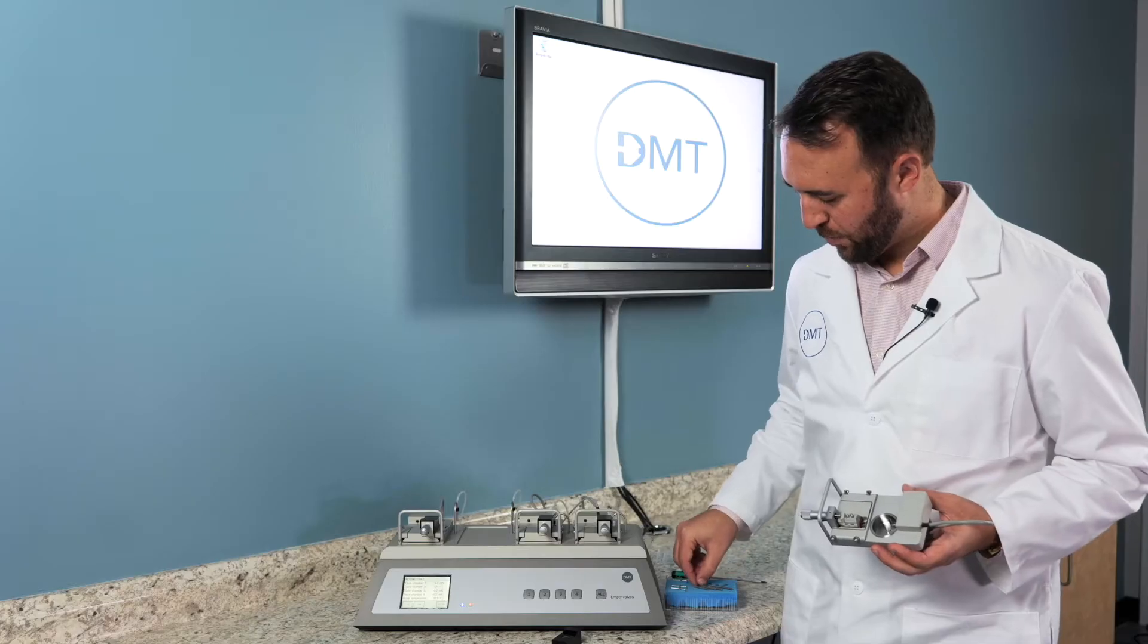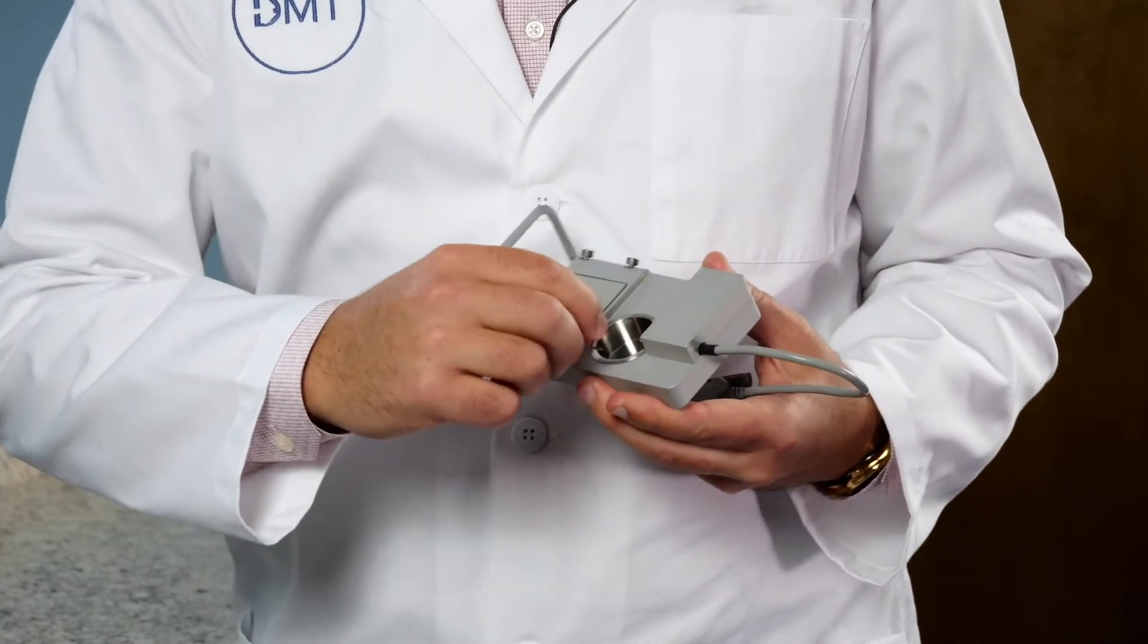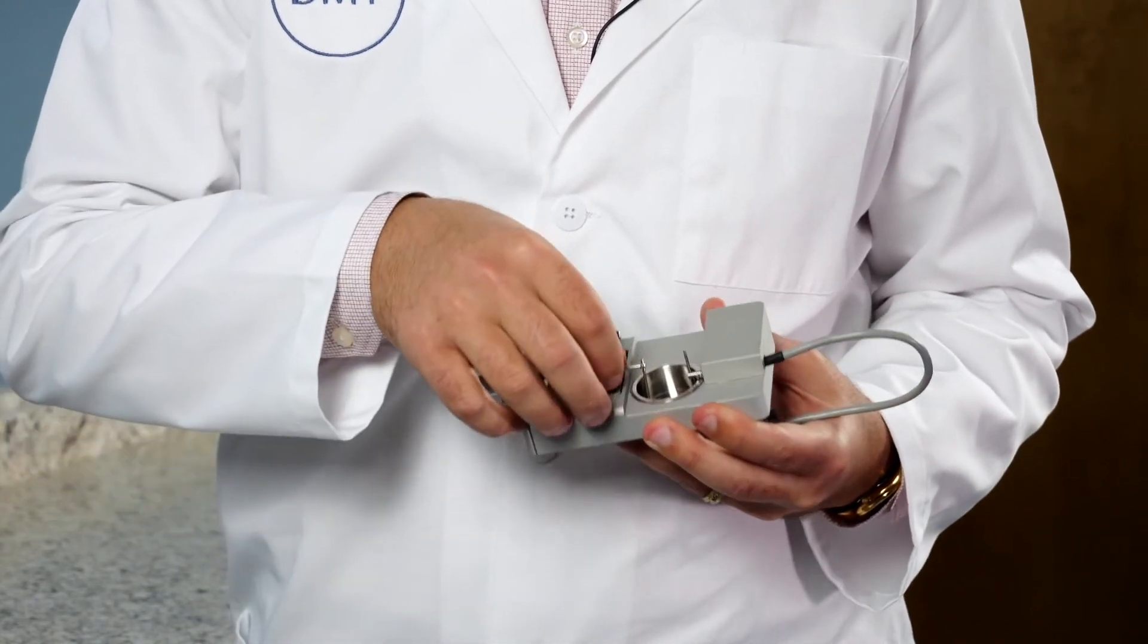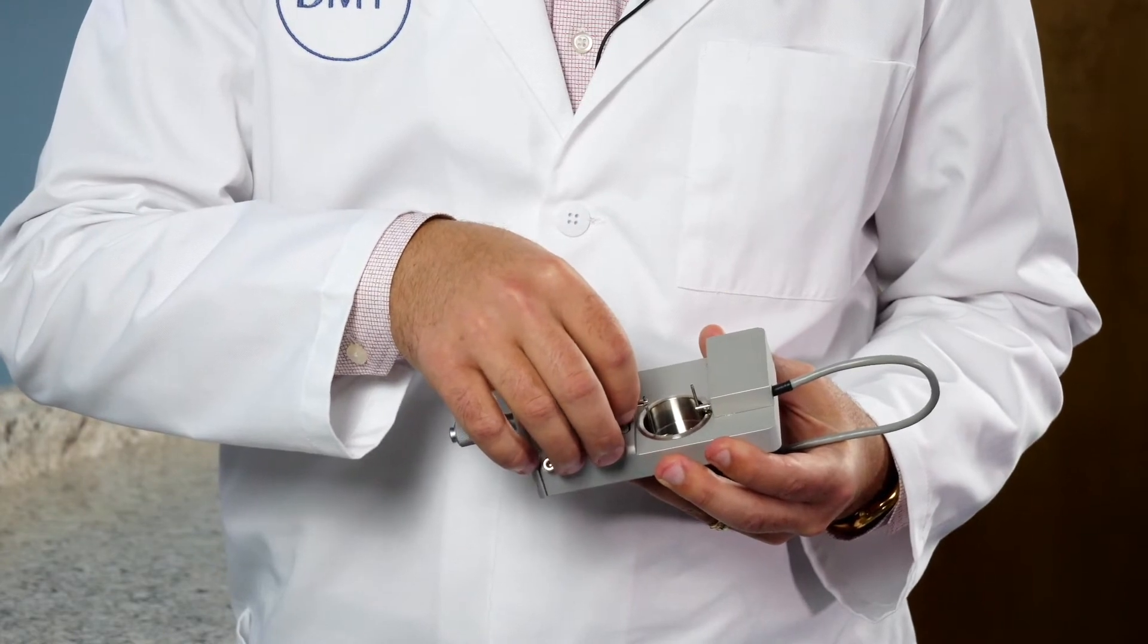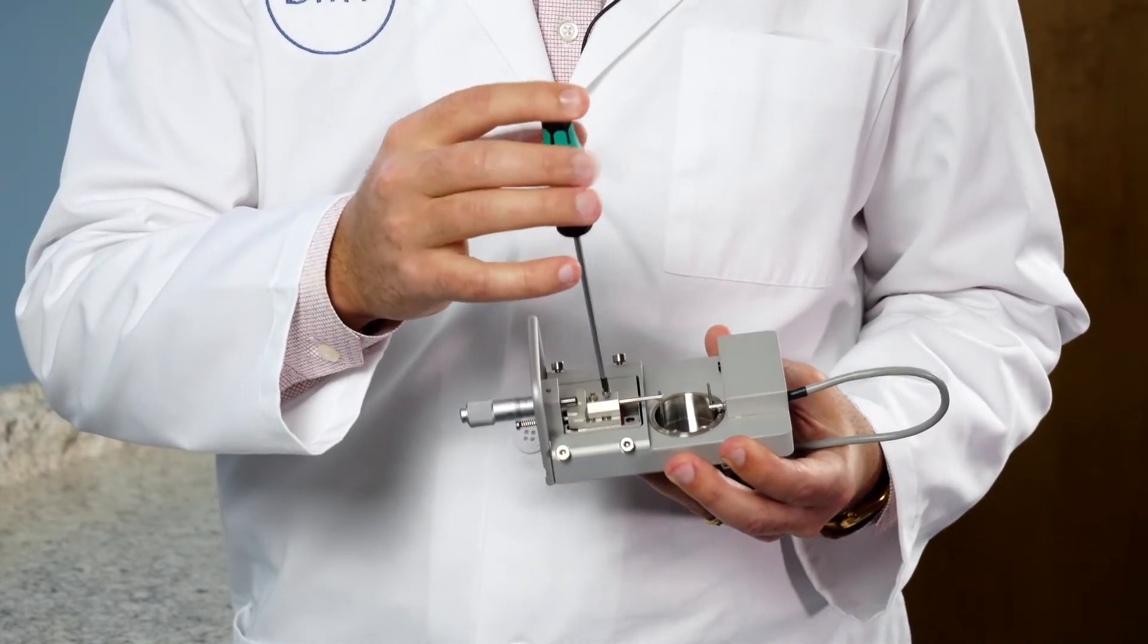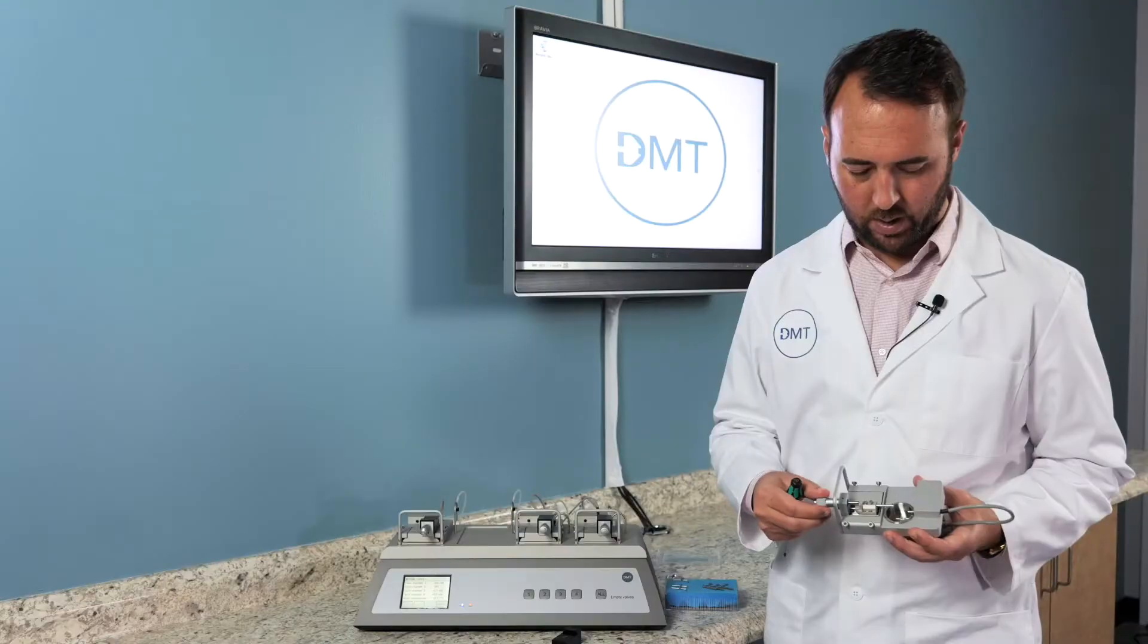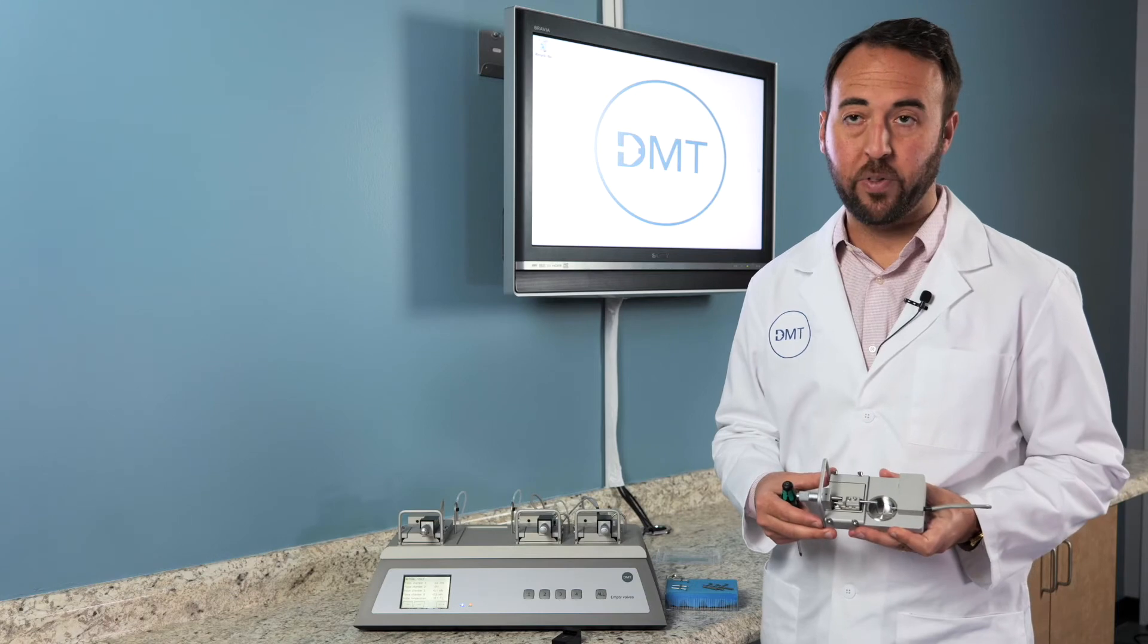And then we will grab the longer armed mount and slide that in to the micrometer side. And take your ball end screwdriver and tighten the closest screw. These will not be perfectly aligned, but you will do that under a microscope in the next step.